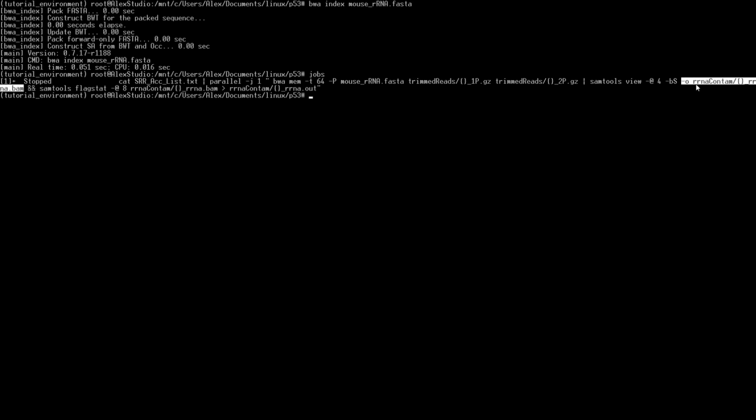So we have to create that folder. That's rRNA contam. This is going to be our rRNA contamination file. And then we want the starting name of the resulting BAM file to have the same name as the input. That way we can keep track of it as we go. So assuming that is completed successfully with the and, we'll go ahead and we'll get some statistics. So SAMtools flagstat, we'll get some statistics from that BAM file. We're going to look at all the flags within it.